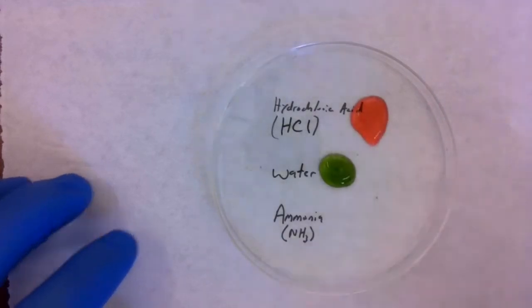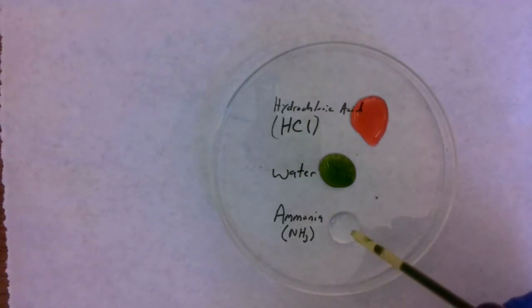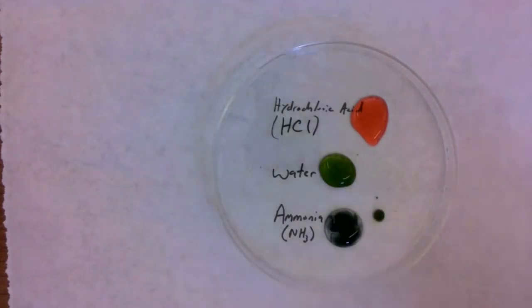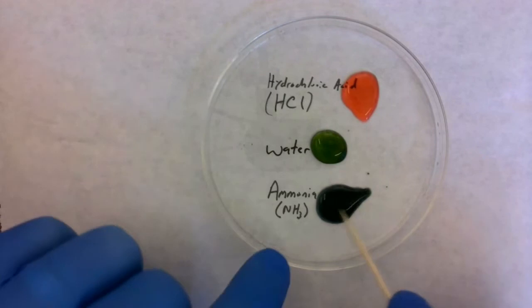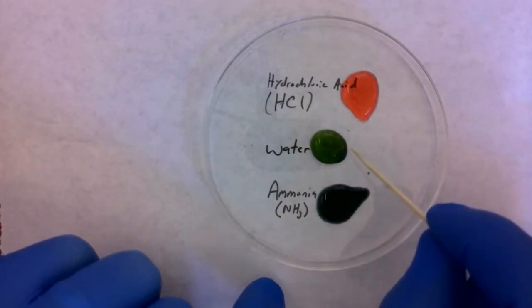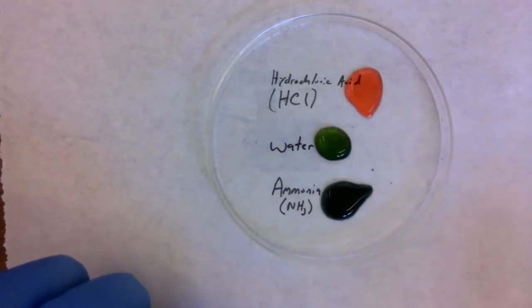A 3 or a 4 would indicate an orangish color, and a 5 or a 6, less acidic, would be a yellowish color. Okay. Now let's go ahead and try a little bit of our ammonia here and see what color that changes the universal indicator. So we added our ammonia, a common substance that we have in a lot of different things. As soon as we put that in, we see that the universal indicator is kind of a bluish color. Okay, so when universal indicator is put into a basic solution, or a pH higher than 7, then we're going to see blues and purples for our color changes.